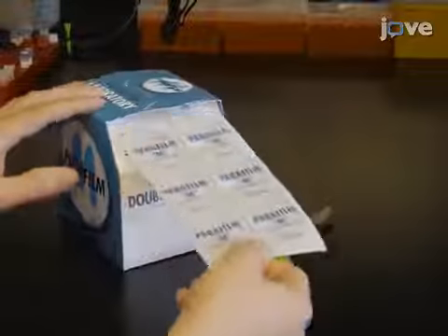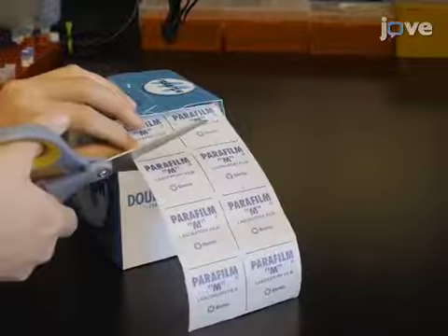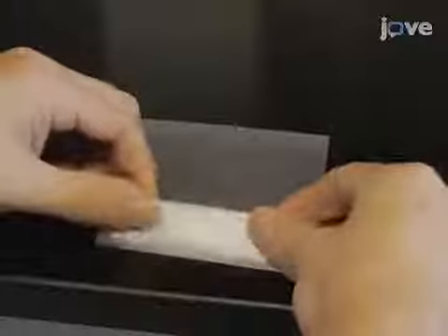Begin the preparation of flow chamber slides by cutting a sheet of paraffin film into a piece measuring 4 inches wide and 7 inches long. Place a standard microscope slide lengthwise on the 4-inch width of paraffin film and wrap the film around the slide 3 to 4 times such that the slide is covered in film that is 3 to 4 layers thick.